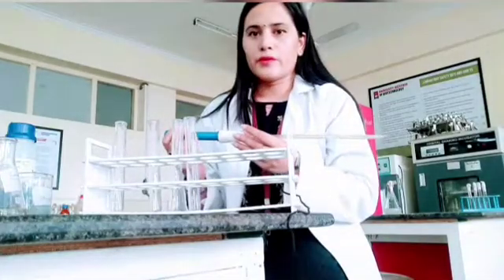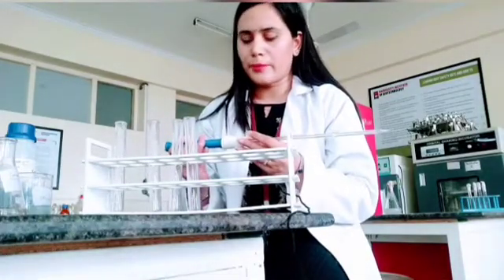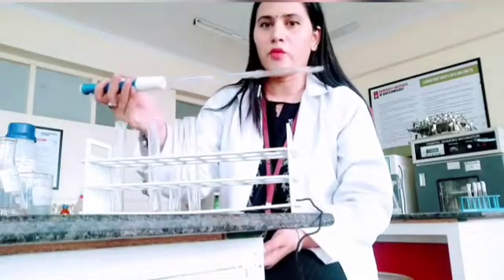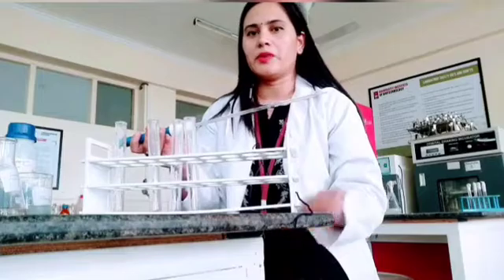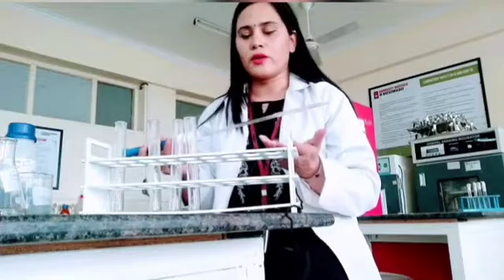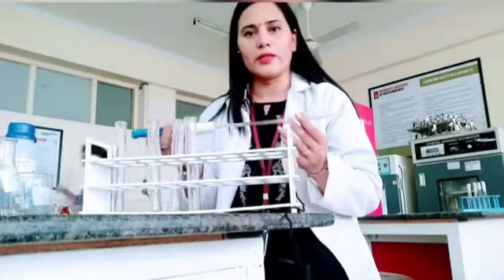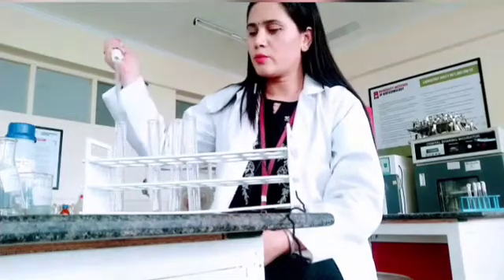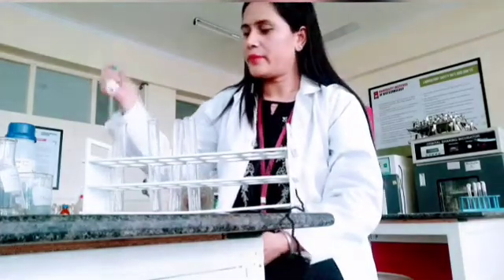And for the sake of this test you need 1 ml of sample. So first of all you have to take this pipette. So pipette is our requirement. Pipette can be anything, or you can take measuring cylinder as well. If you take measuring cylinder, that can also work. If you don't have measuring cylinder, then you can take pipette as well. So I will be taking 1 ml. So both the samples I will take 1 ml.